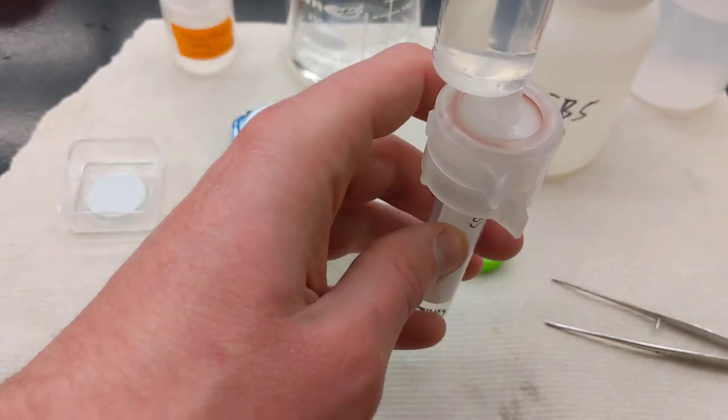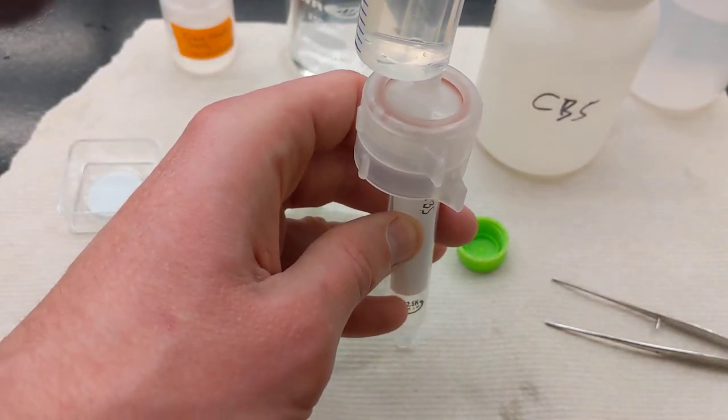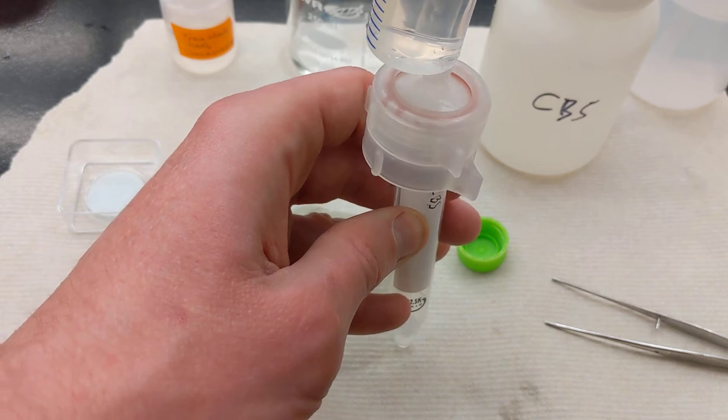And you can do this in a rack, a test tube rack, or you can just do it directly like this. And then start depressing.